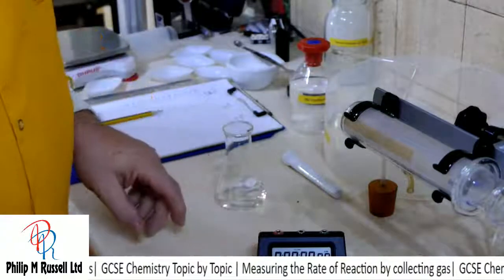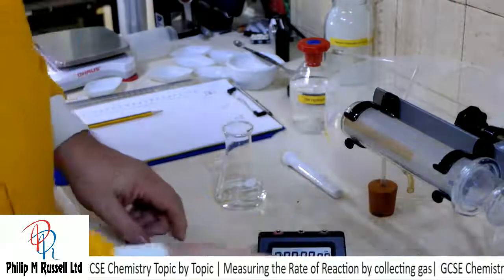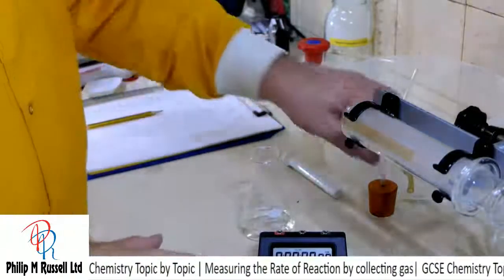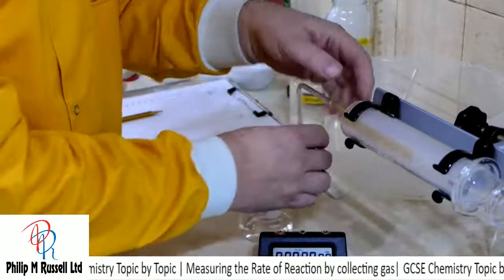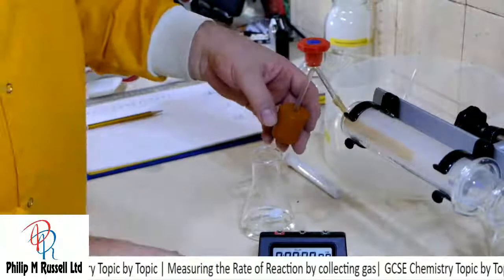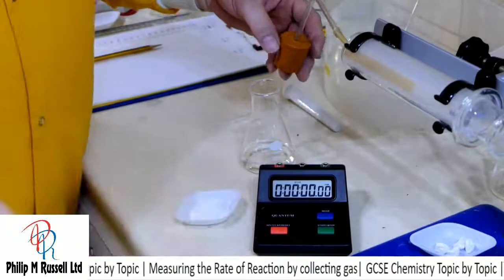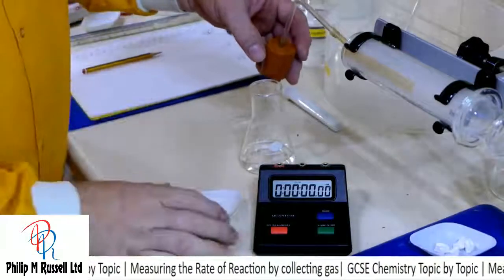We've got the timer, I've got my amounts, we're going to put the acid in there, we've got it in there, I've got this already on. What I want to do now is to put this in there, and I'm going to start the timer, and we're going to watch the readings on there, and I'm going to call them out as we go.